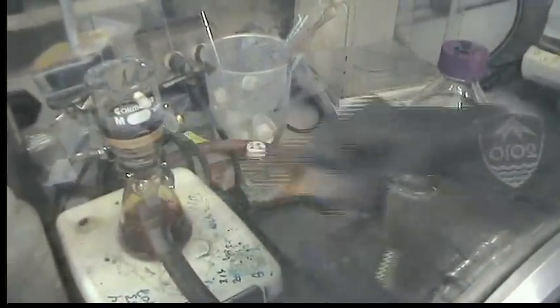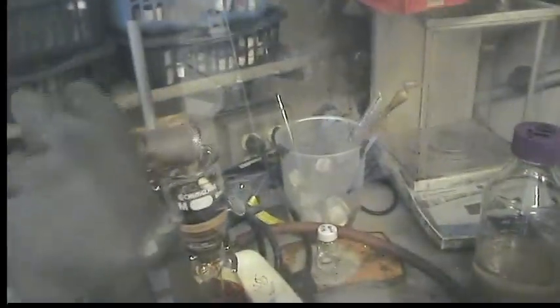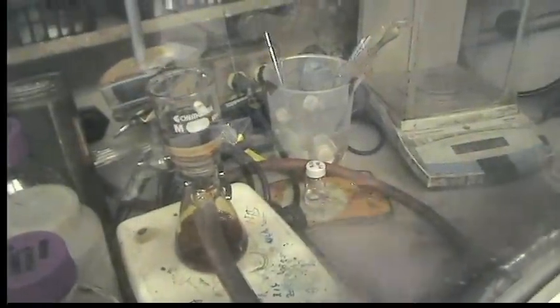So you can see our filter cake is almost clean. We'll add this last bit of toluene. Let that go through and then we'll take it to dryness. I'll come back later to see how that looks.